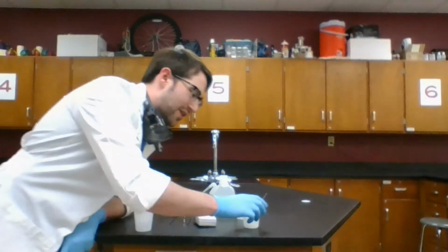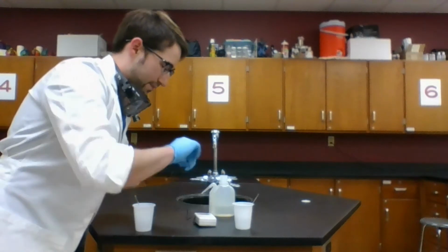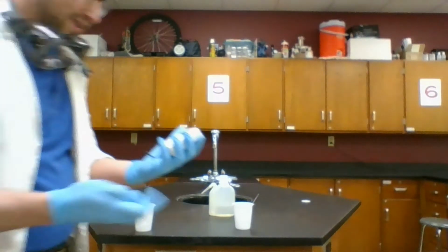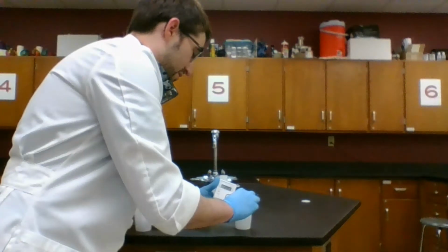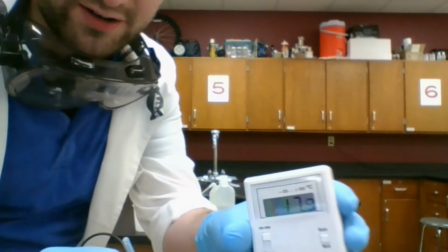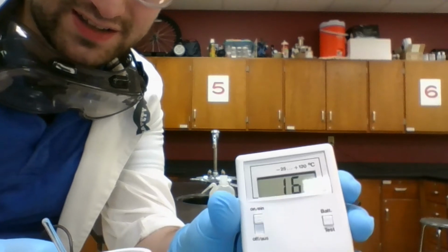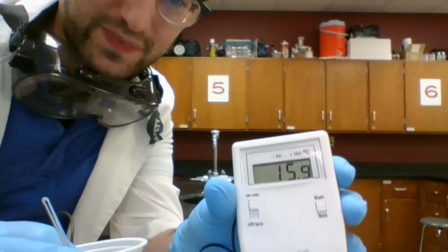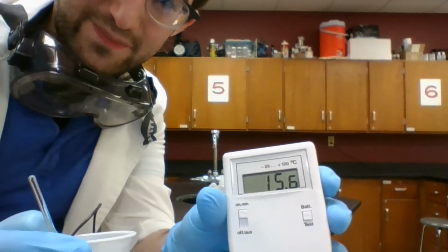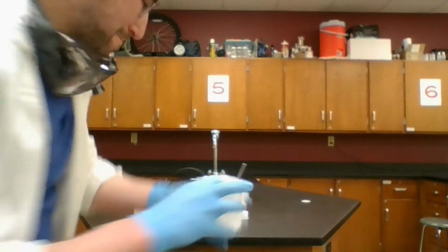Now, on the other hand, with my ammonium nitrate, I go and check this. My probe is still sensing a high temperature. Drop that in my ammonium nitrate in water, and it's dropping precipitously. We're down to 16 degrees Celsius. It's still going down. We're down to 15. It keeps going and going and going, which is pretty chilly. And same kind of idea. I can feel the bottom of this cup, and it's a little bit cold.